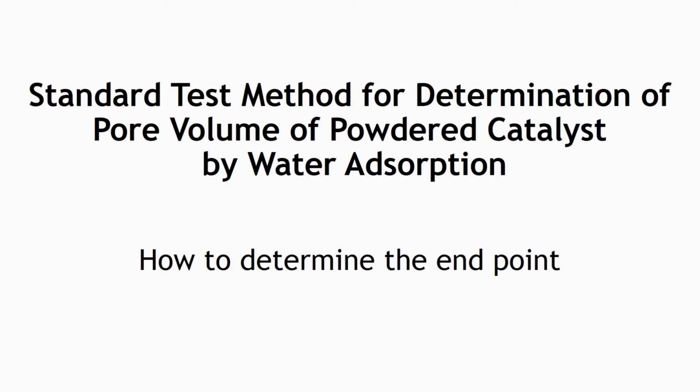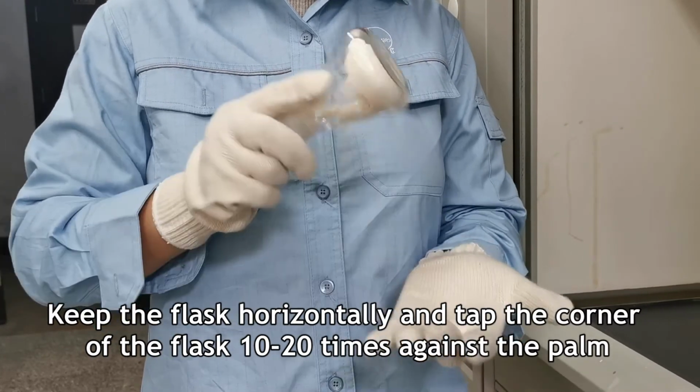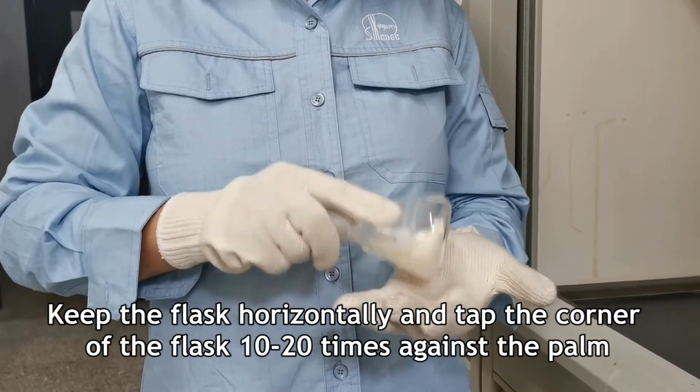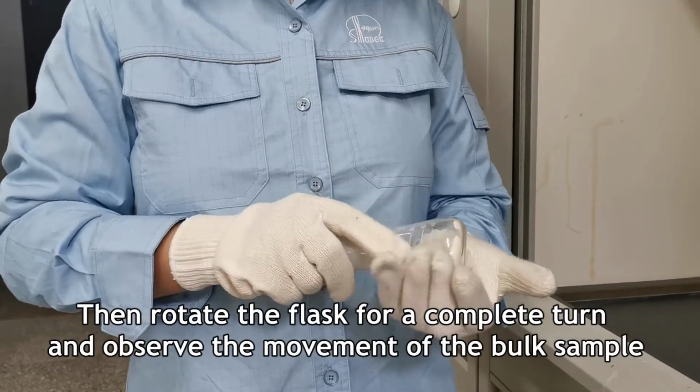This video is about how to determine the end point. Keep the flask horizontally and tap the corner of the flask 10 to 20 times against the palm. Then rotate the flask for a complete turn and observe the movement of the bulk sample.